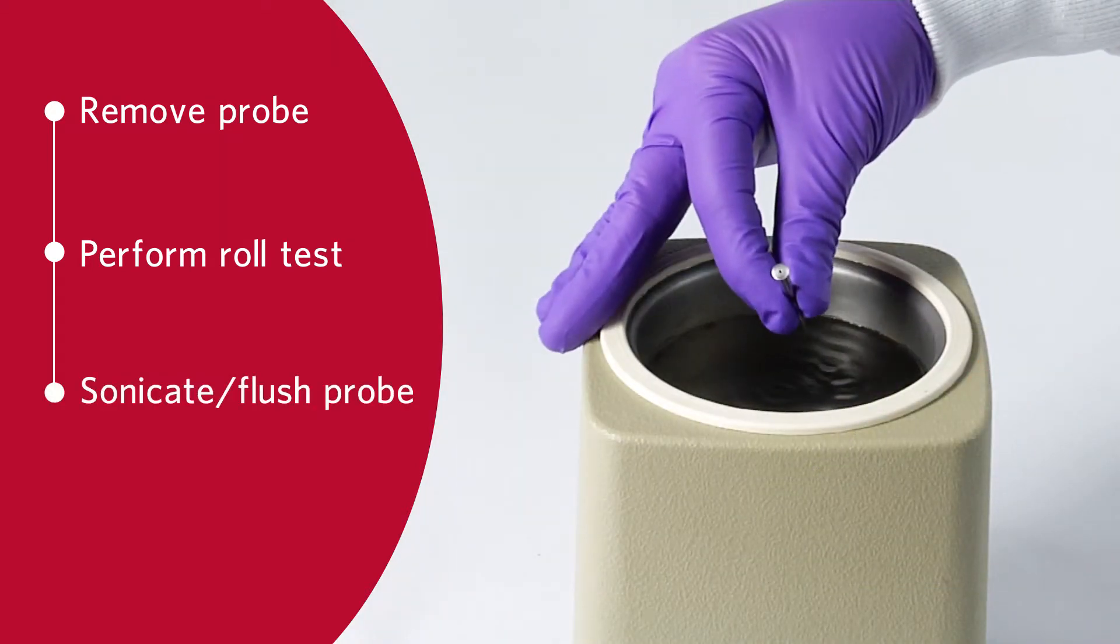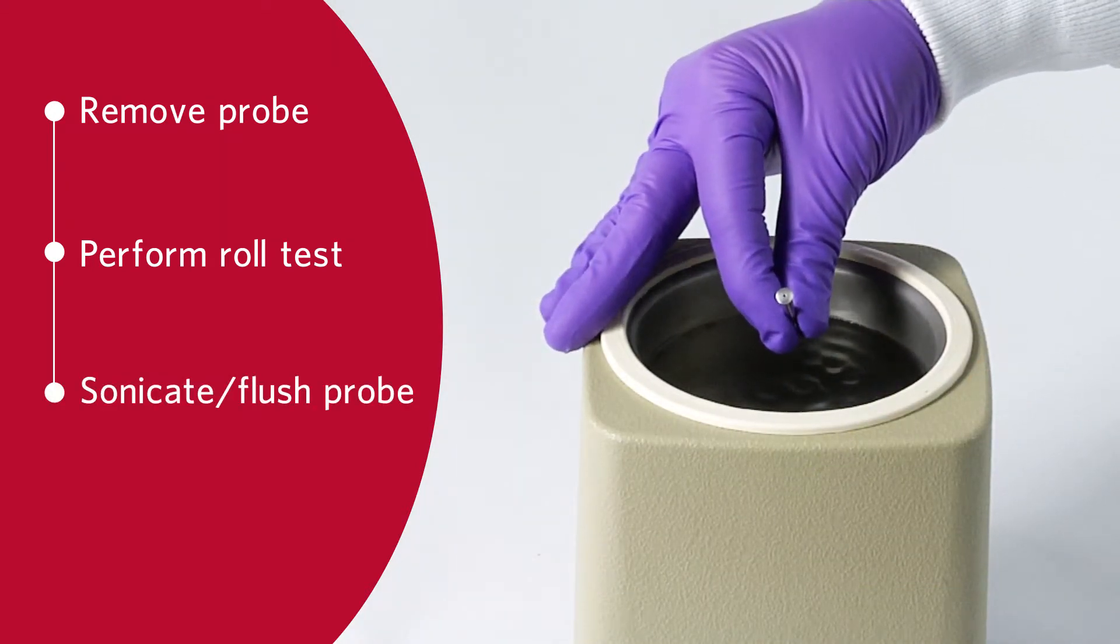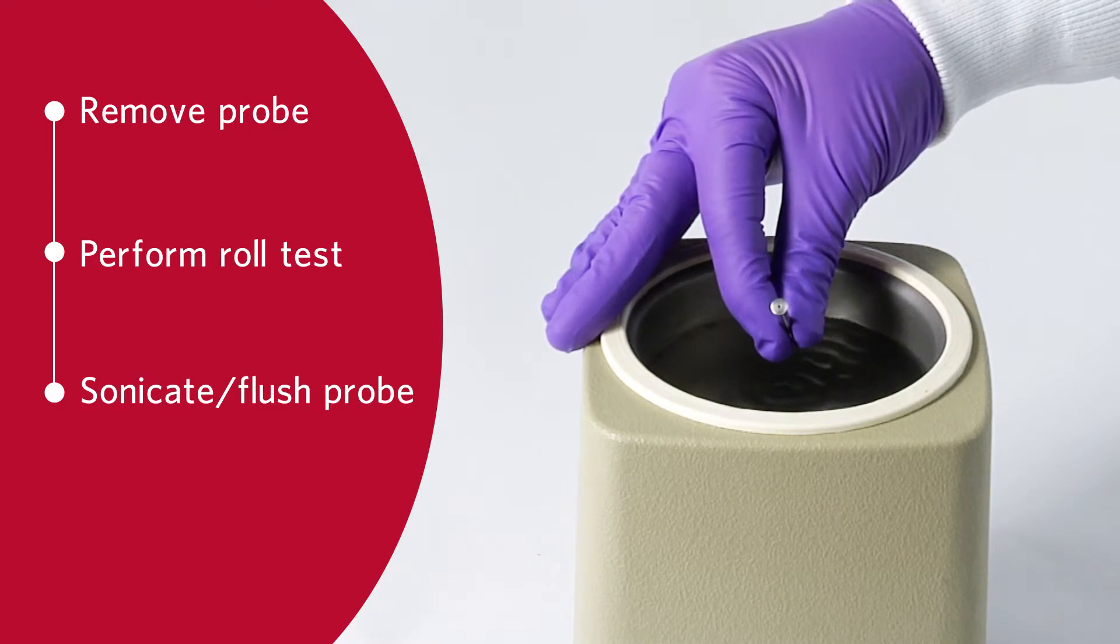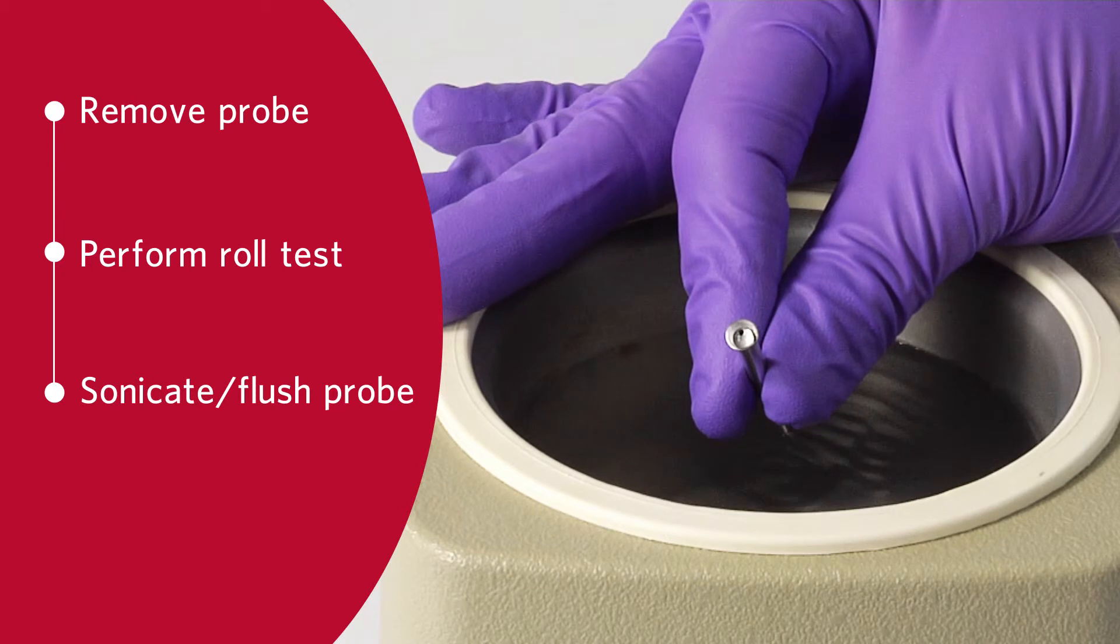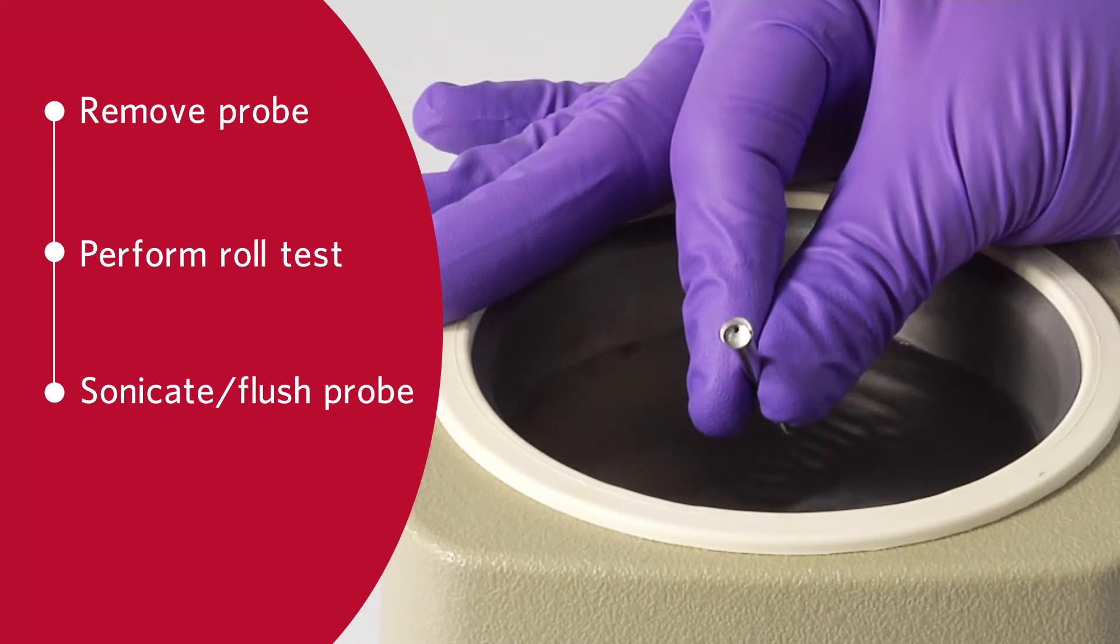Clean the sample probe using either a bath sonicator or a 10 µL syringe or both. If using a bath sonicator, place the tip of the sample probe in the bath sonicator for 2-5 minutes.